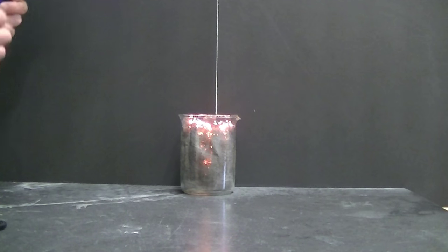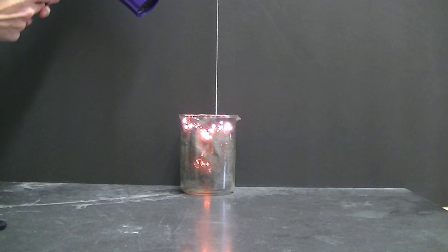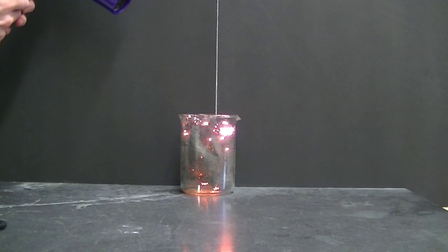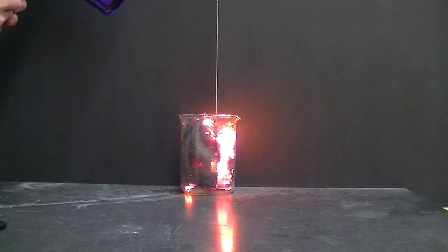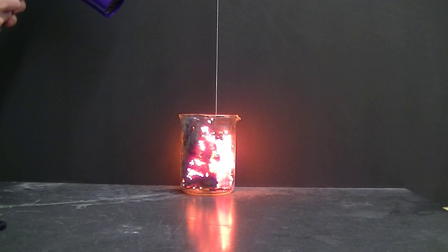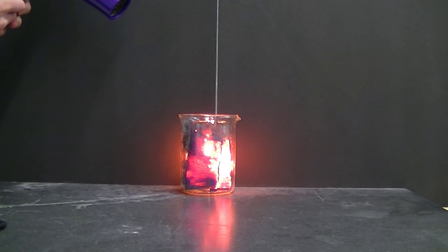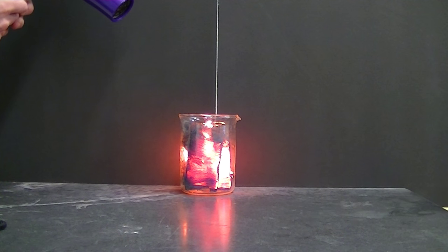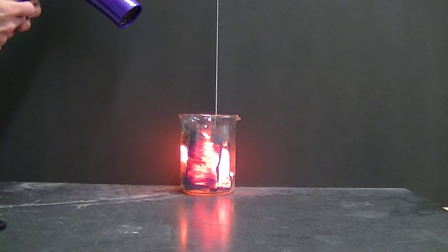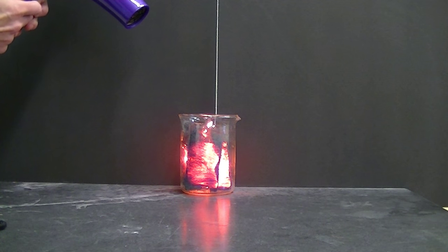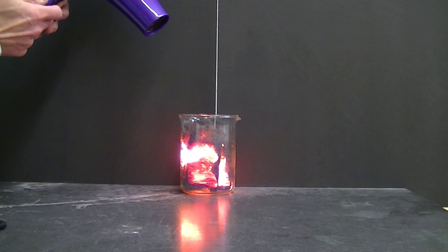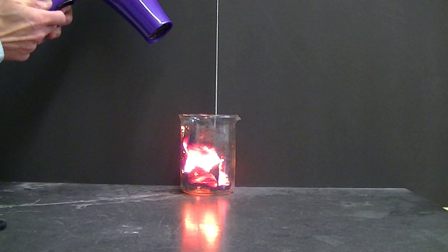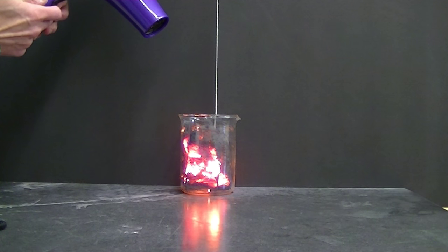Get this lit. Keep burning. Set my hairdryer on low. And I'm trying to completely burn the steel wool but not produce too many sparks that exit the beaker. And as the reaction calms down, I can get the hairdryer closer and closer to ensure that all of the steel wool has reacted.